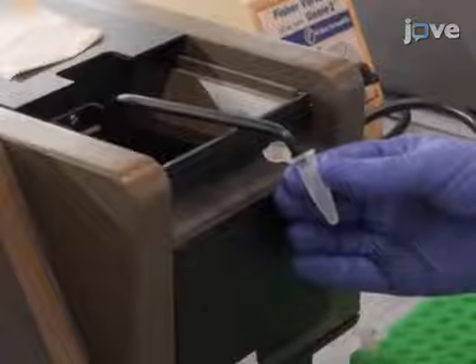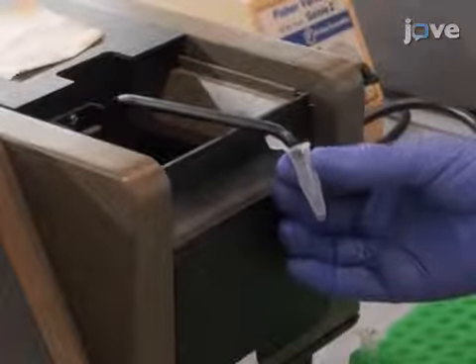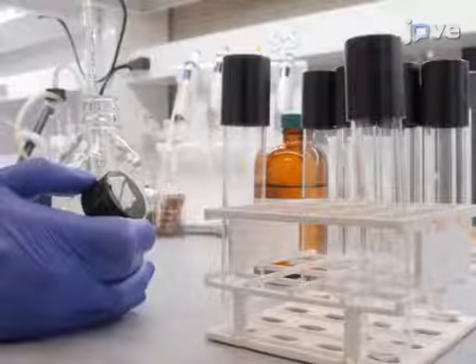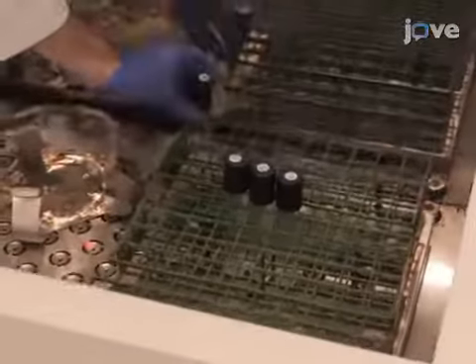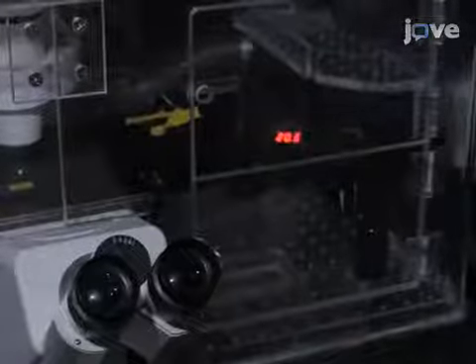Approximately 3 hours before imaging, measure the OD600 of each overnight culture. Then prepare 5 milliliter dilutions at an OD600 of 0.35 to 0.4 in YNB medium, lacking additional nutrients for plasmid maintenance, and grow at 30 degrees Celsius with shaking for 3 hours. During the incubation, pre-equilibrate the microscope's environmental chamber or heated stage to 30 degrees Celsius.